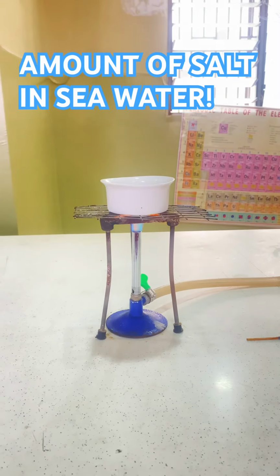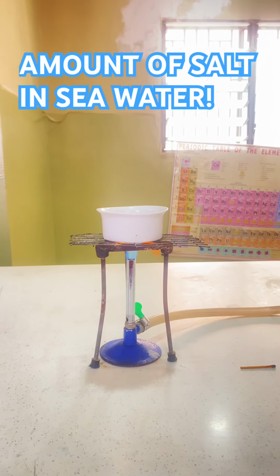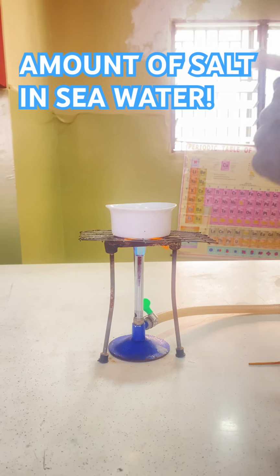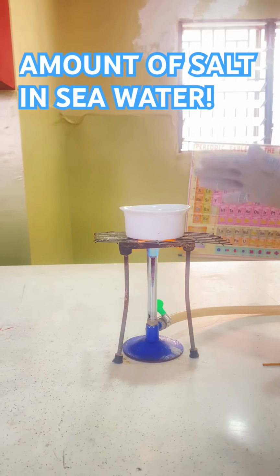So now, as you can see, we have put our salt solution in the evaporating dish onto a Bunsen burner. We are going to wait for it to boil. What is going to take place is evaporation. Whilst evaporation takes place, the salt is going to crystallize. So we are going to wait for the water to boil and for the salt to crystallize.